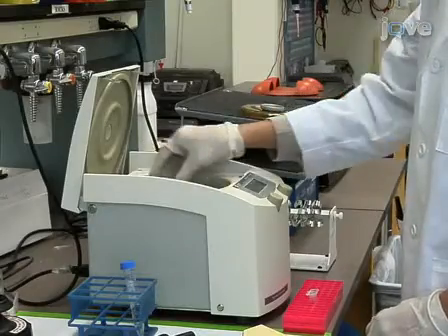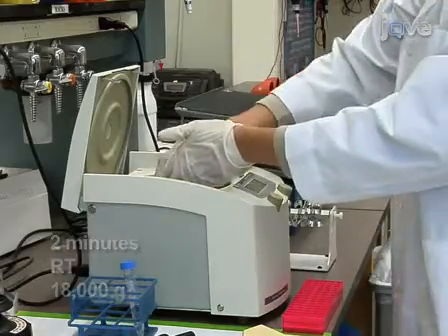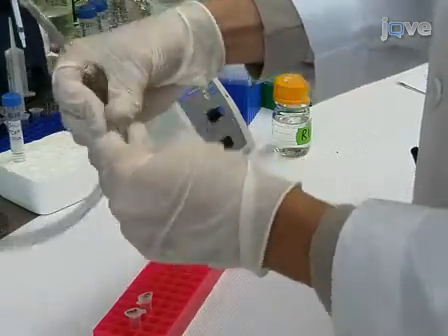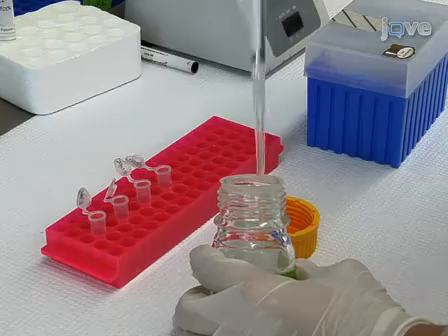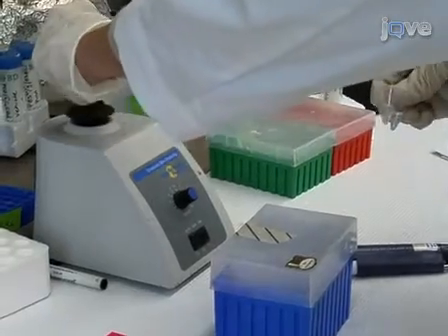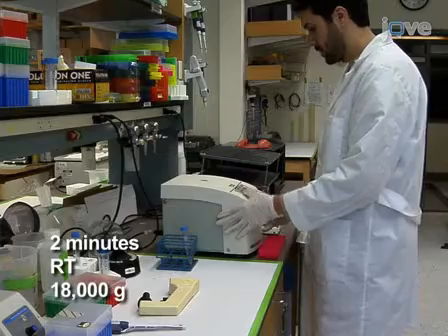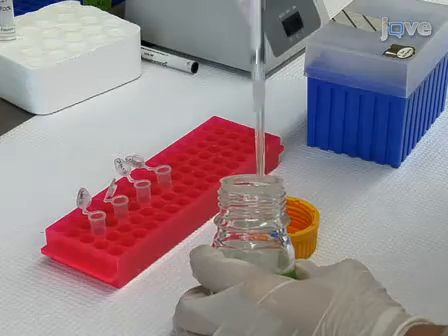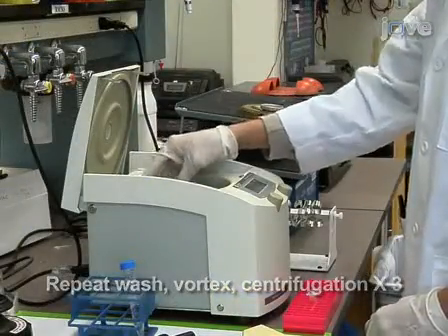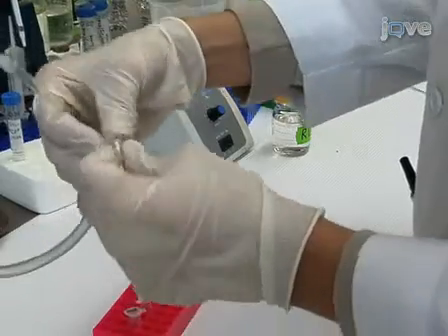The following day, collect the beads by centrifuging samples at 18,000 g for 2 minutes at room temperature. Aspirate off the lysate, being careful not to approach the bead pellet with the aspirator. Add 0.75 milliliters of room temperature RIPA buffer to each tube and vortex at top speed to wash the beads. Centrifuge at 18,000 g for 2 minutes at room temperature to collect the beads, and repeat this wash-vortex-centrifuge cycle two more times for a total of three washes. After the final wash, aspirate as much buffer as possible without disturbing the bead pellet.